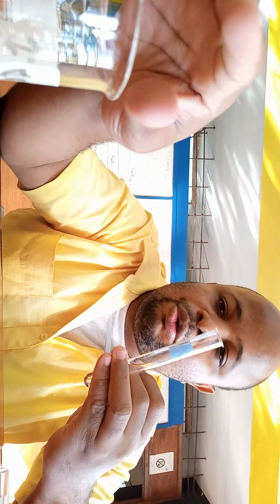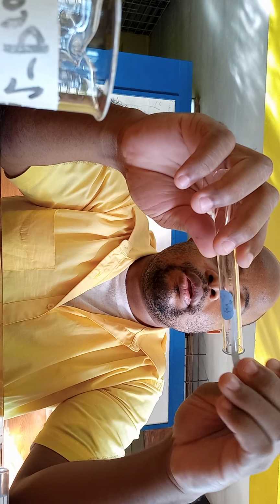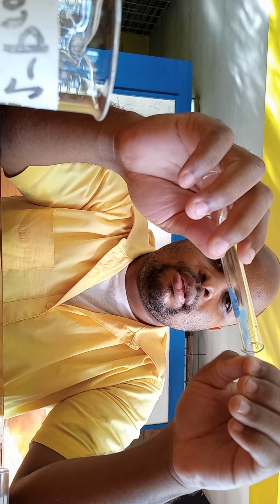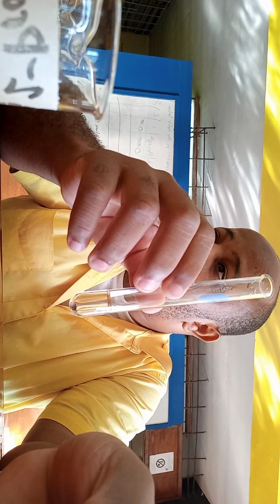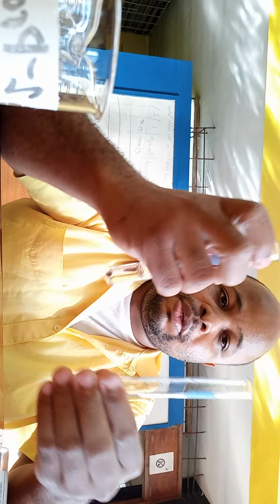I have blue litmus paper. This is test tube A, which was 2-propanol, the ketone. You can see here, there's a small portion of it. Just a second. Right, so it changed to red. That would be due to the presence of the sulfuric acid, and the same thing for test tube C.